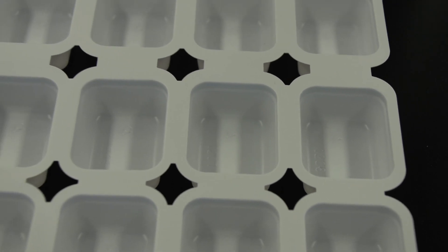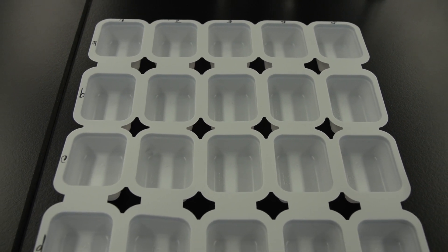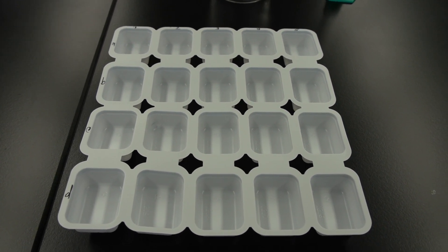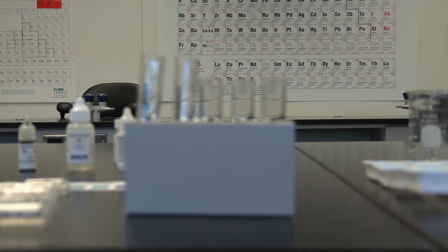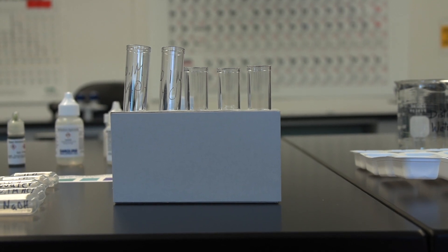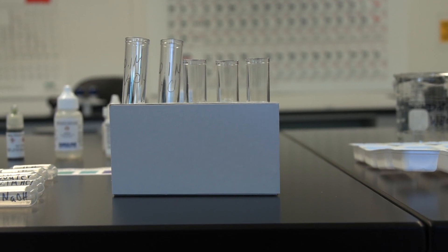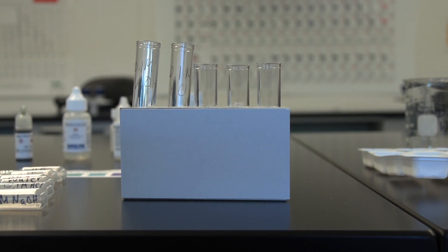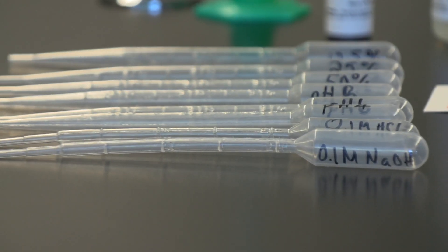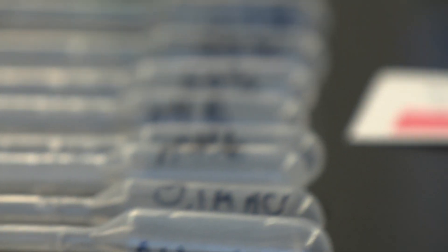This labeling scheme provides a unique alphanumeric identification number for each well. Use the grease pencil to label the two test tubes 0.1 molar sodium hydroxide and 0.1 molar hydrochloric acid. Label two one-milliliter graduated dropper pipettes 0.1 molar hydrochloric acid and 0.1 molar sodium hydroxide. Label four three-milliliter graduated dropper pipettes: water, pH 4, pH 6, and pH 8. Label the 250 milliliter beaker distilled water.